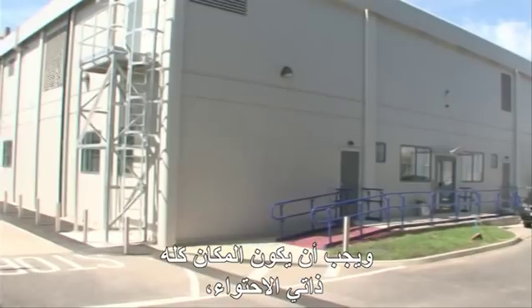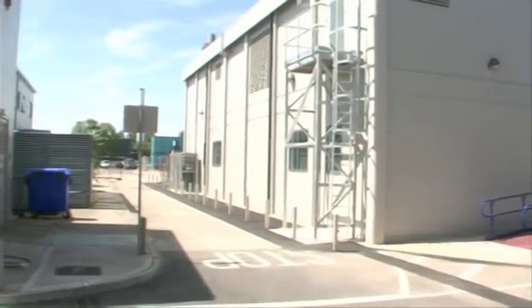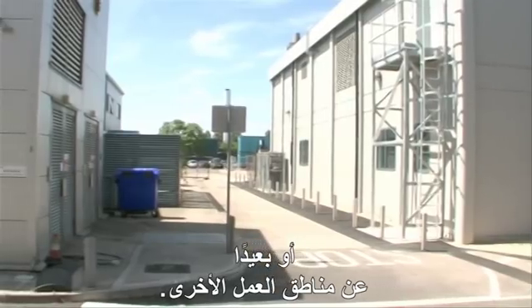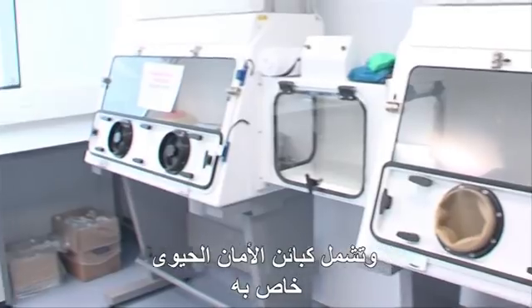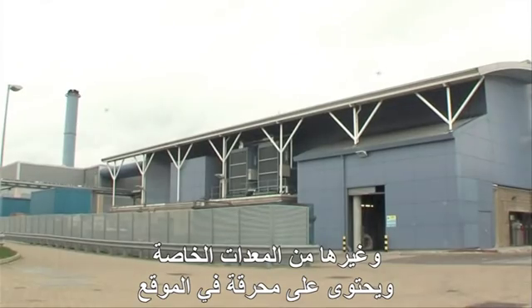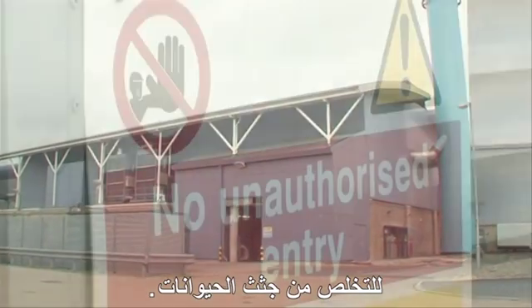The facility itself should be completely self-contained, either housed in its own building or set well apart from other working areas. It will house its own biological safety cabinets and other specialist equipment and have an incinerator on site for the disposal of animal carcasses.